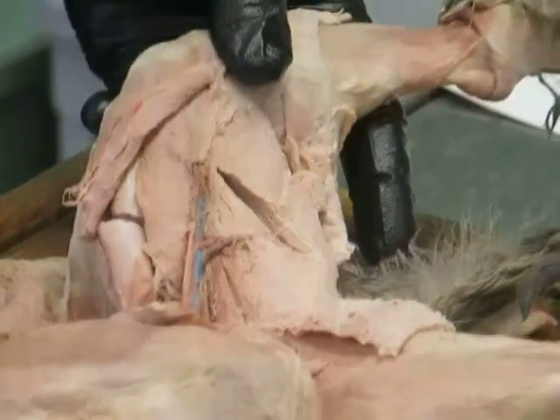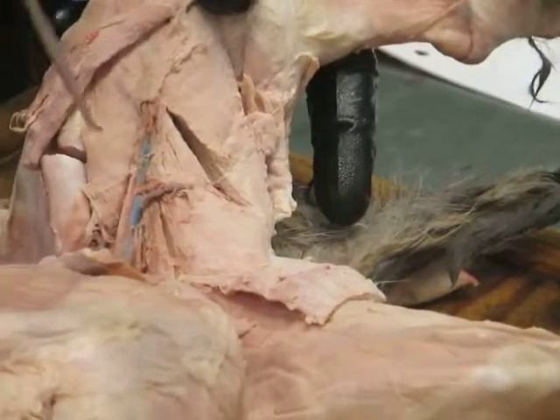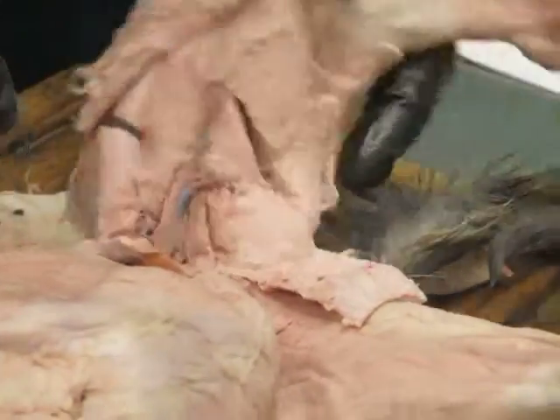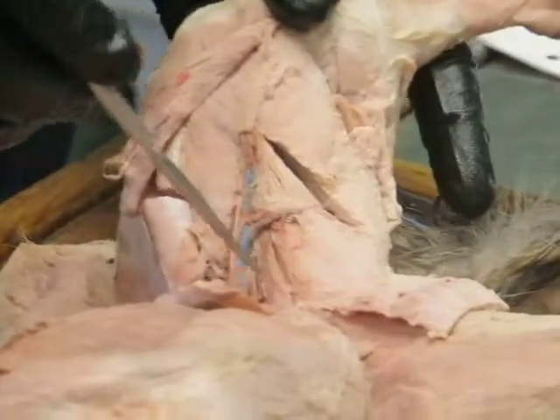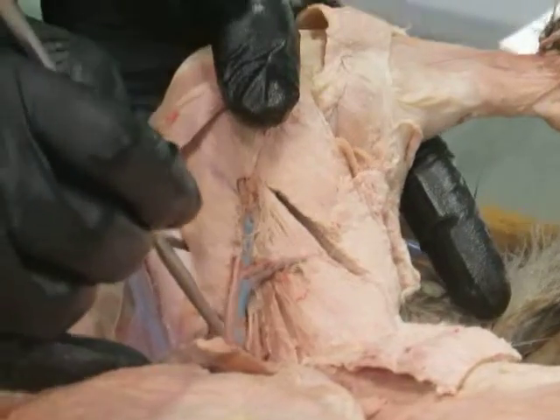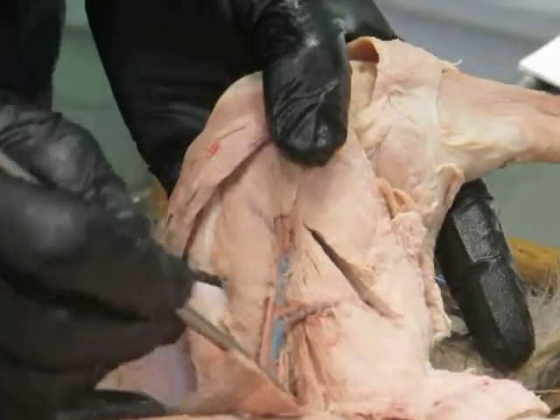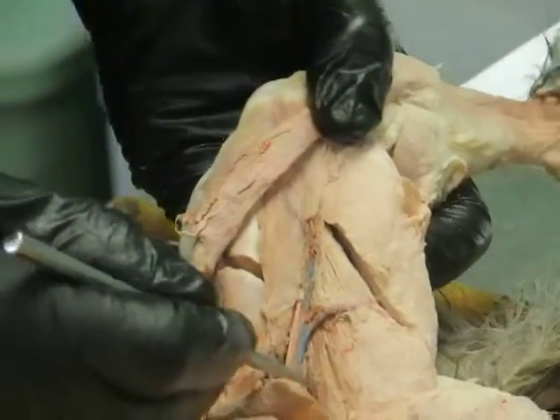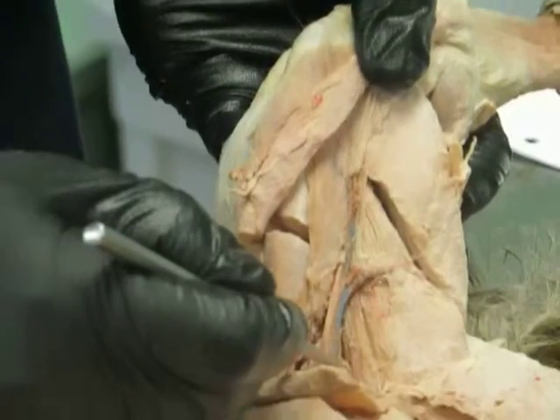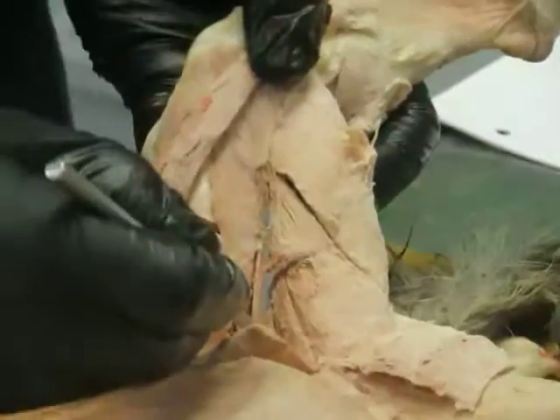Adduction. Okay, is that a good question? Yeah. But there are adductors of the thigh at the hip joint. So there's adductor magnus et brevis, adductor longus, and then there's another little muscle that you'll see right in here. This guy right here. See that? And it starts with a P. Anyone? Not peroneus, pectineus. That's the pectineus.